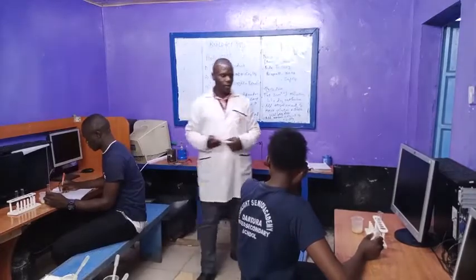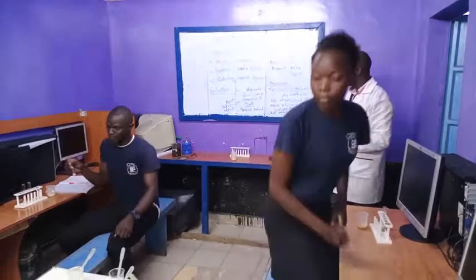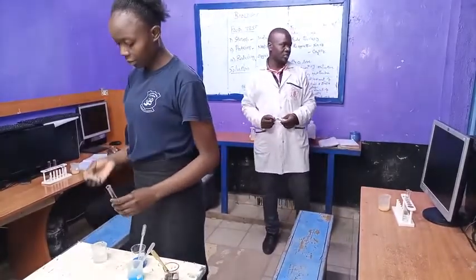So kindly confirm with the liquid that you have if the colors have changed or the colors have persisted.